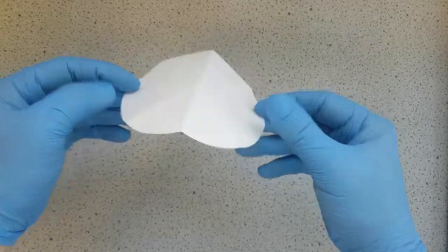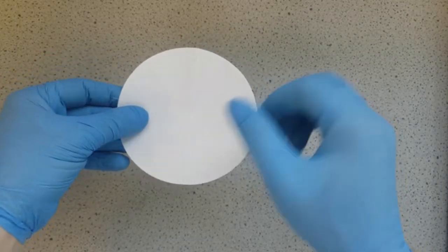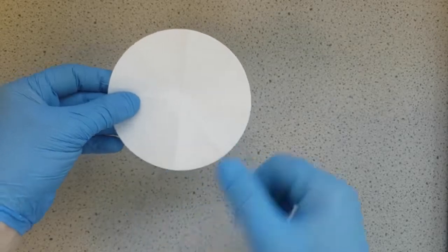So next, rotate, we'll turn our paper over, and then we're going to fold in between the folds that we've originally made.